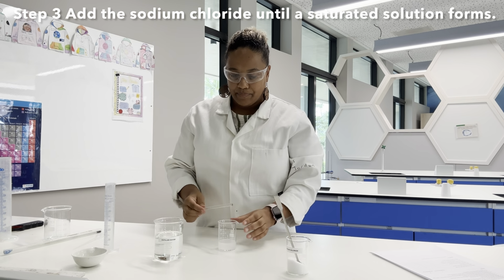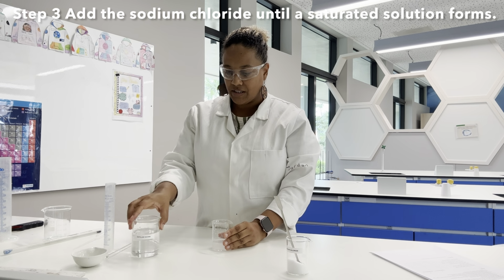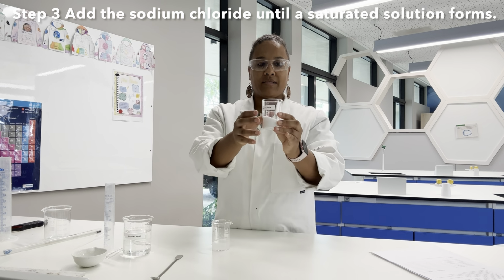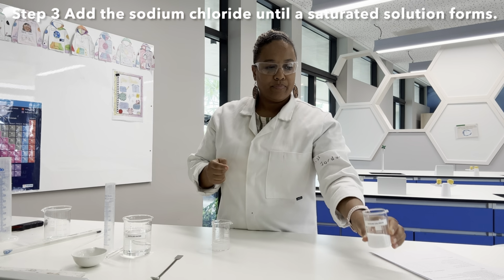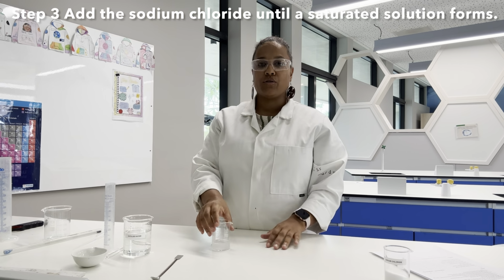Okay, now I'm going to make sure my glass rod is between two pieces of equipment so it doesn't roll off my bench. I'm then going to go and measure the mass of my beaker. And now I can work out the difference of how much sodium chloride I added to my water.